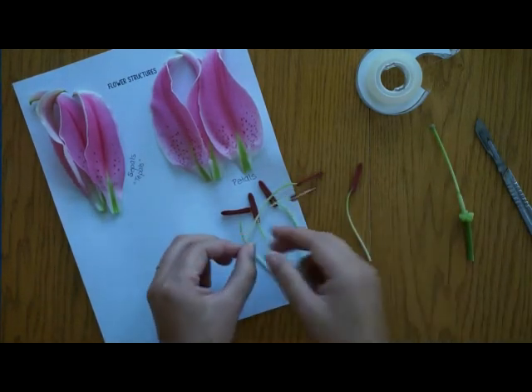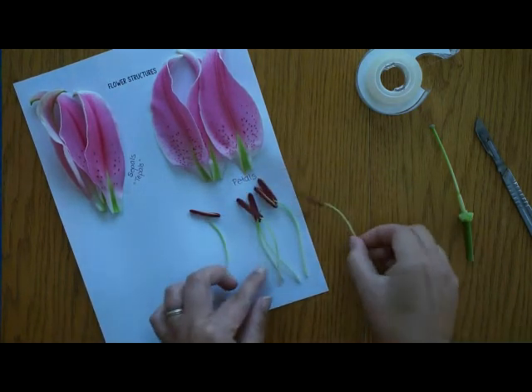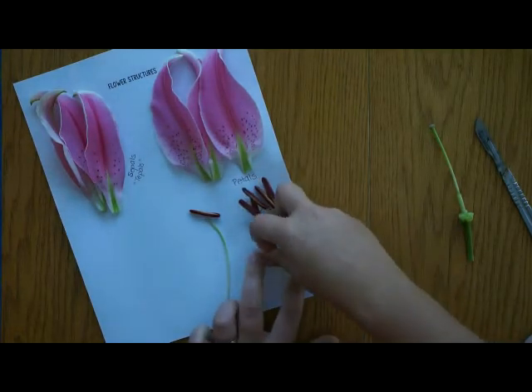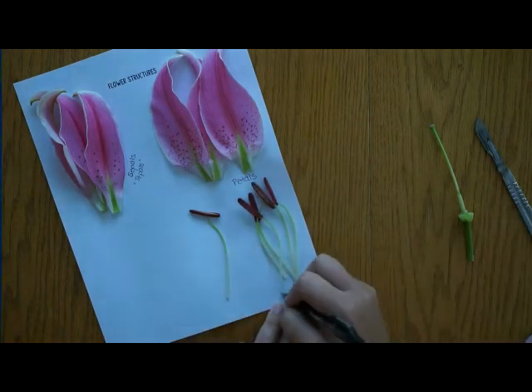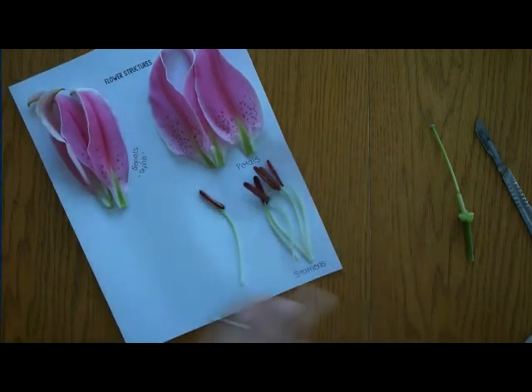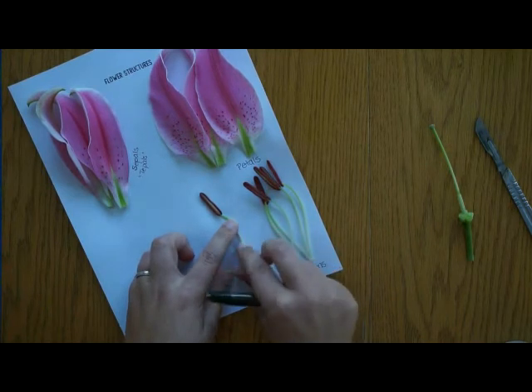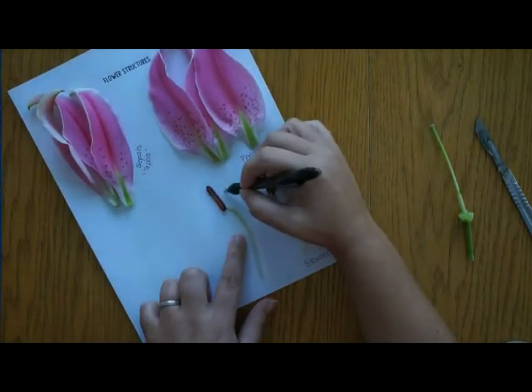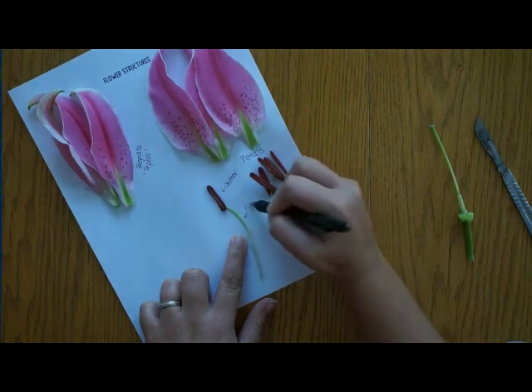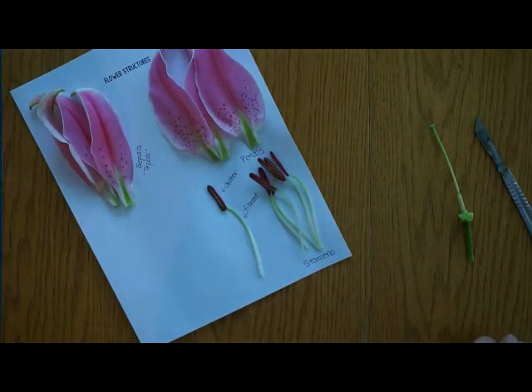The next step is to tape those stamens down. Pull one of them out separately because we're going to label that one individually. Tape them all down and label the group as stamens, since that's the complete term. For that individual stamen, tape it down and label the anther — the top portion that holds the pollen — and the filament. Read about the functions of each of these structures in your lab and answer them on your observation page.